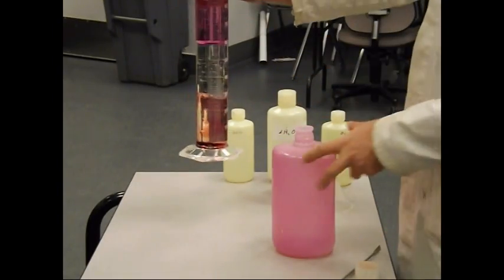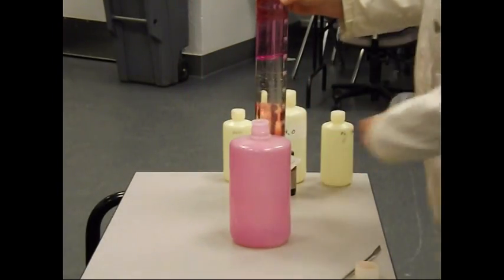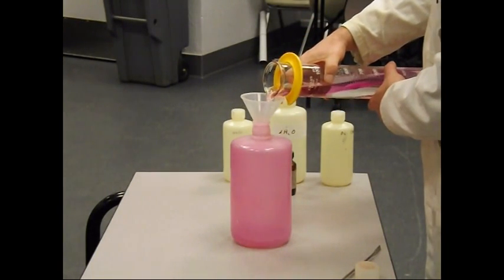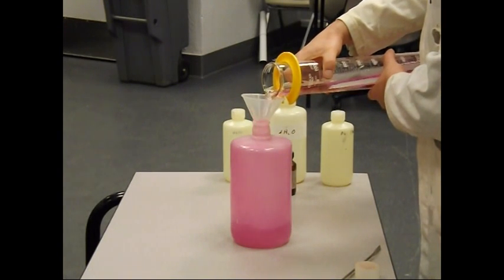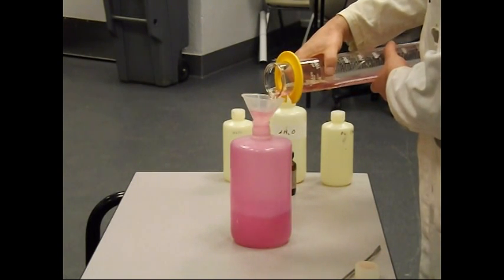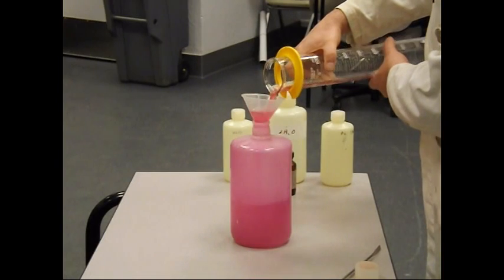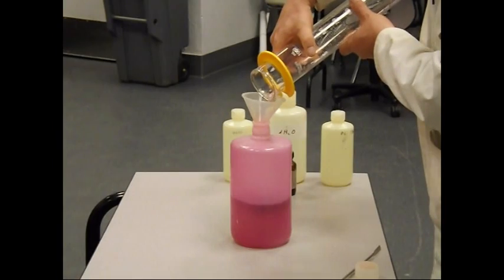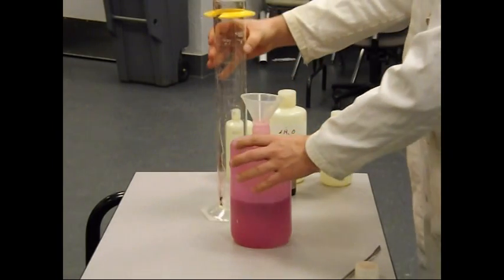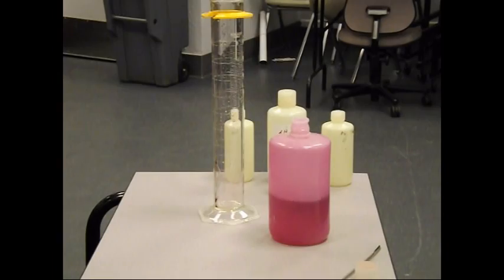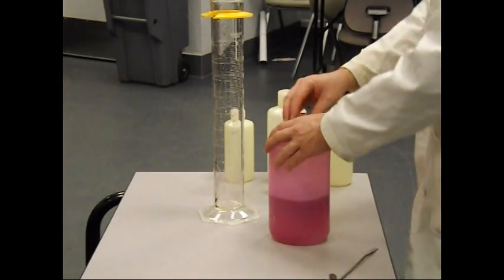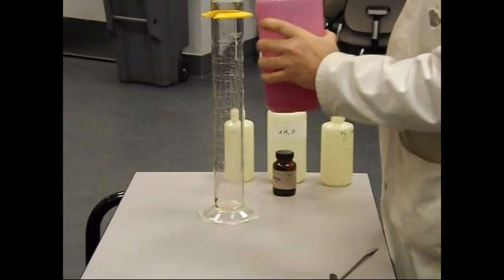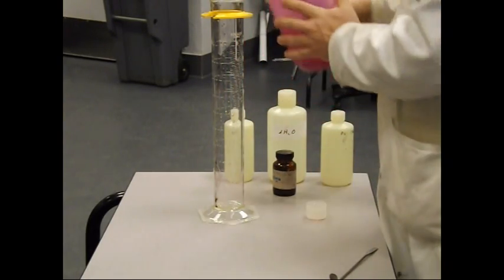So, but what about this water layer? What I'm going to do is pour it out in here and see what happens with iodine in water. The last of it is poured out. And to ensure we've got this stuff mixed up really well, pour it back in.